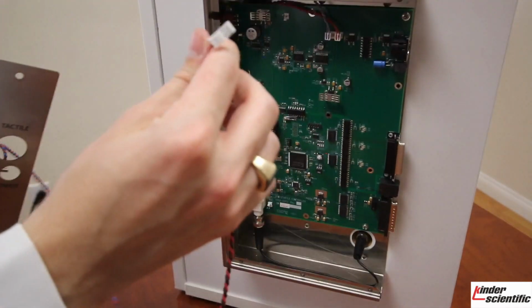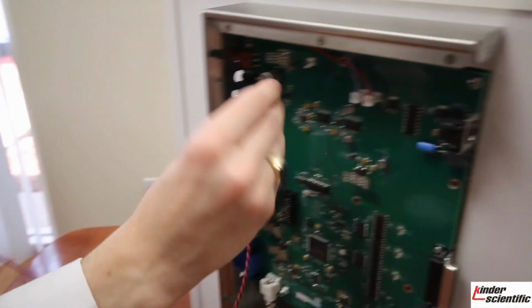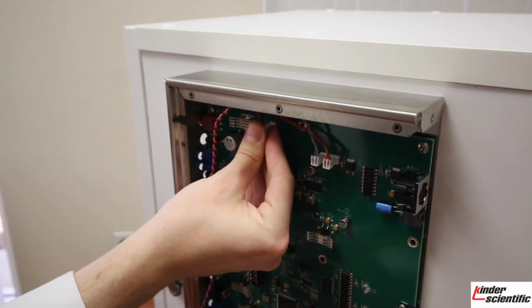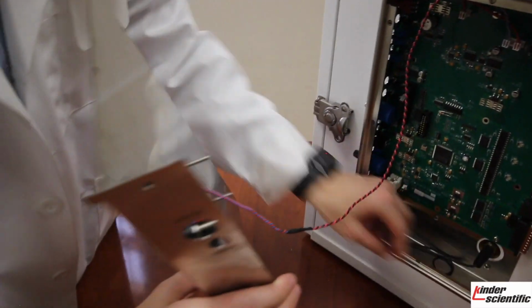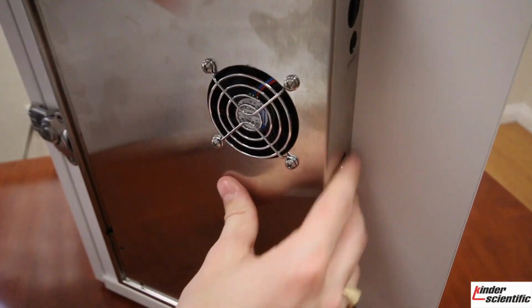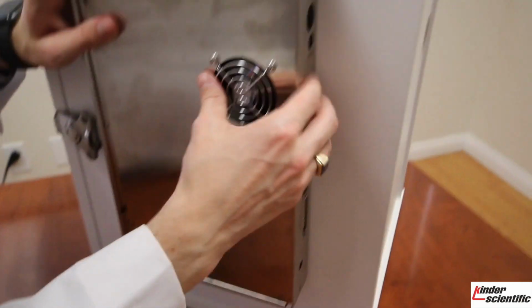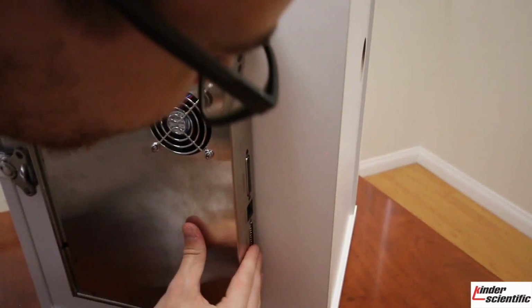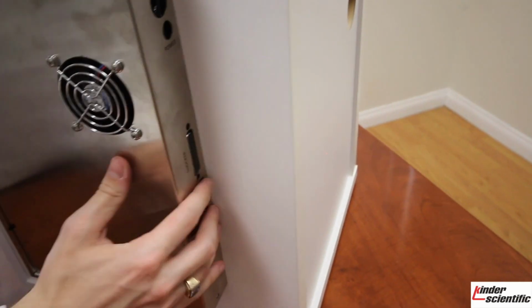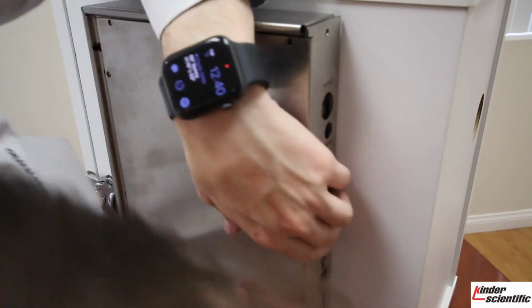You will need to reattach the fan. So you can see there's a small little notch there that it just slides in, and it should click right in there. Ensure all these cables are not in the way, and you will, when you place this, you will take it slightly off and slide it on, so that, as you can see, these ports here need to line up. There we go.